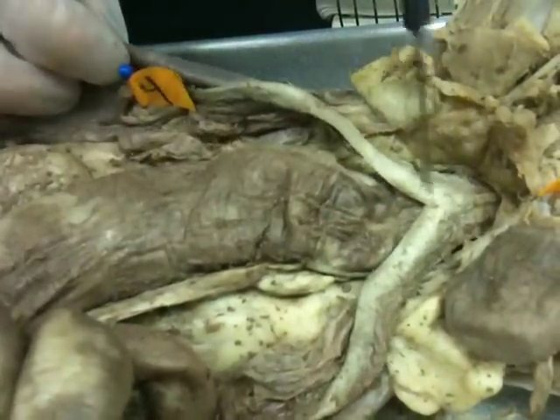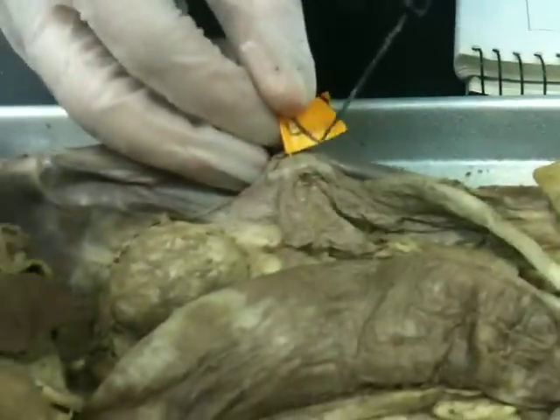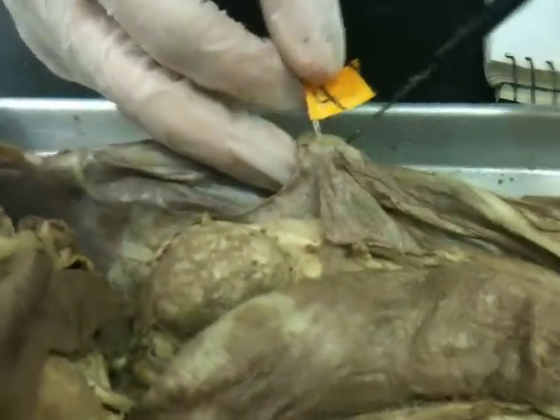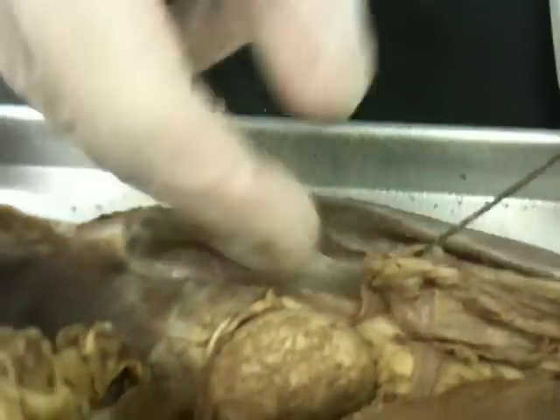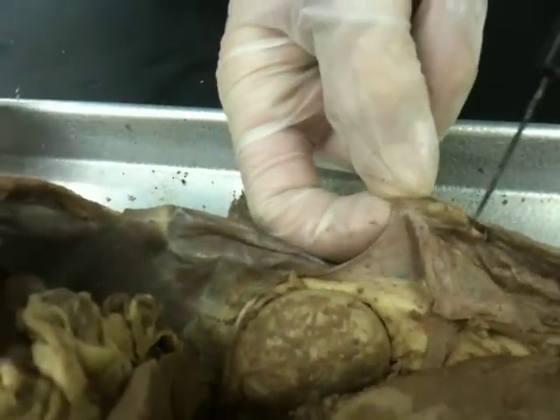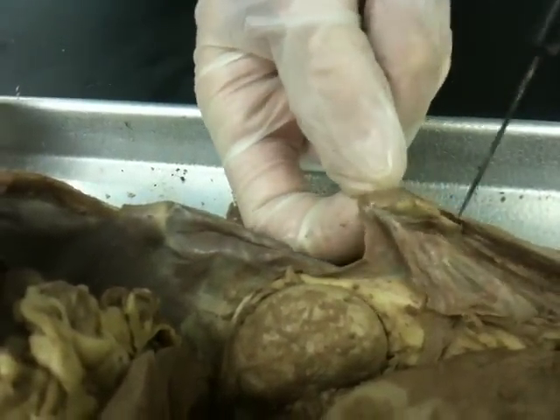These obviously go into the ovaries. This small structure right here — almost looks like an adrenal gland — is the ovary, which is connected to the uterine horn.